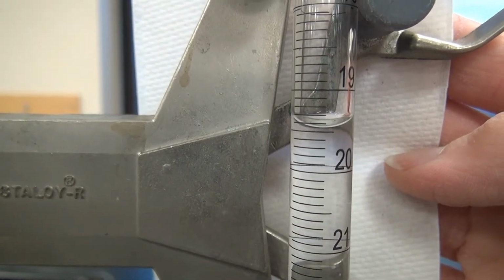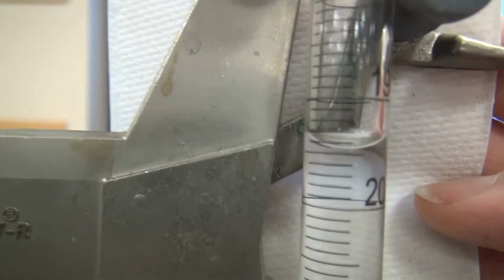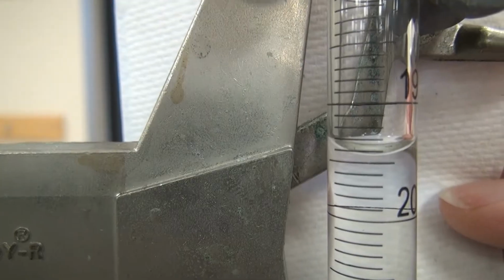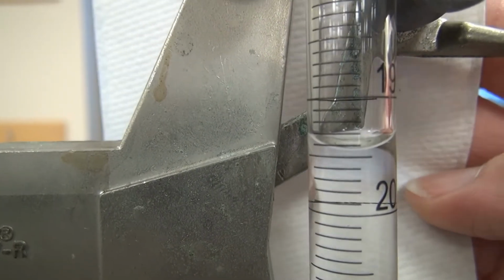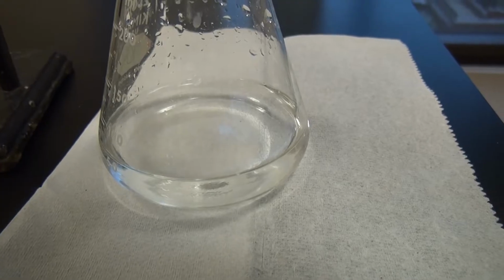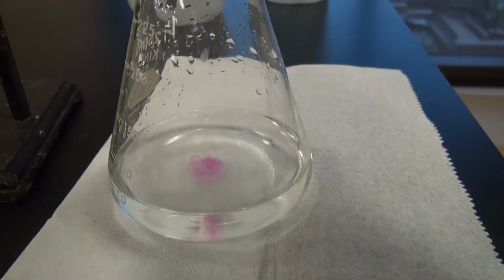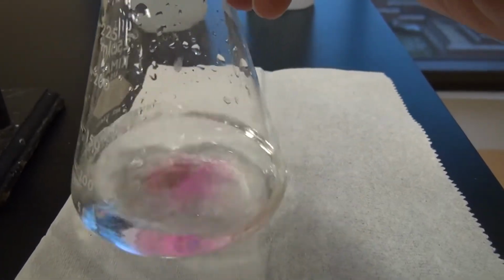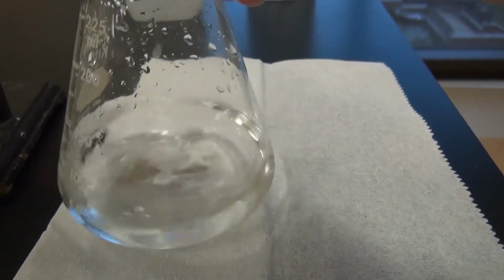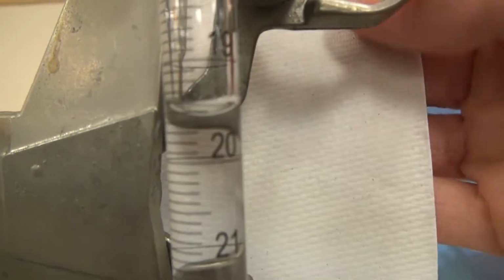Okay, got your reading. We're so close. Maybe this next one will send it over the pink. Okay, let's get a really good reading on this one. I think we can.